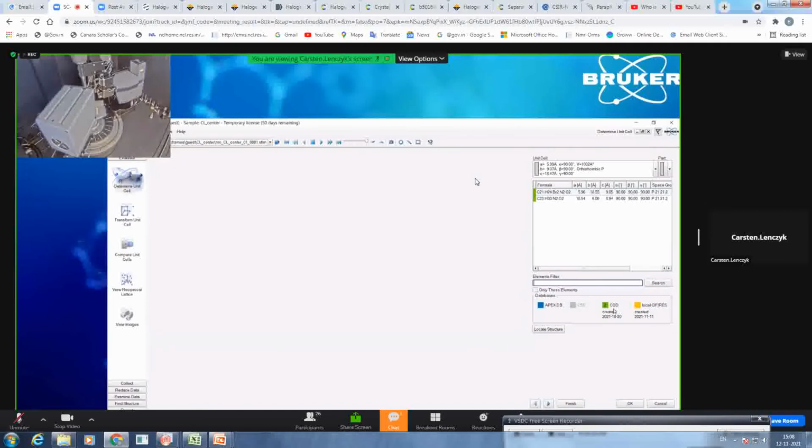The CSD database, COD database: the first time you open this plugin, it will ask you if you want to install it. Click yes. It will take 10 minutes, then it will install the database. And you see here now that you have some entries. If you double click it, it will redirect you to the homepage and show you the entries. And you can cross-check if it might be the complex that you, or a person you are measuring for, have submitted, to omit that you will remeasure something which is already published and just lose precious measuring time.